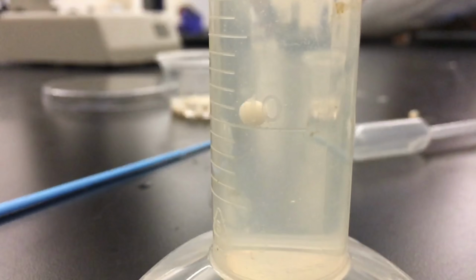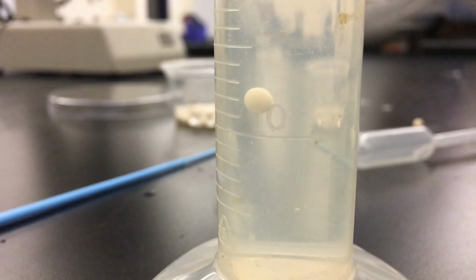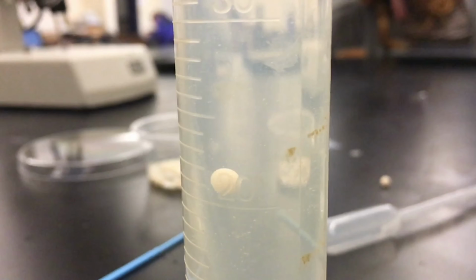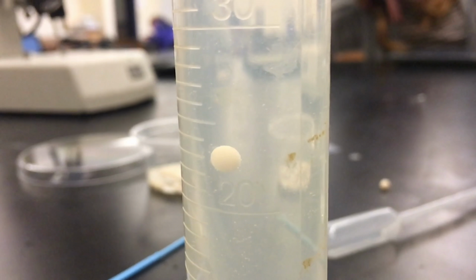It was probably the same thing, but as you can see, the bubbles are going up and along, and some are attached to the ball of yeast, kind of like what happens if you leave your cup out, and oxygen bubbles will bind to the side.